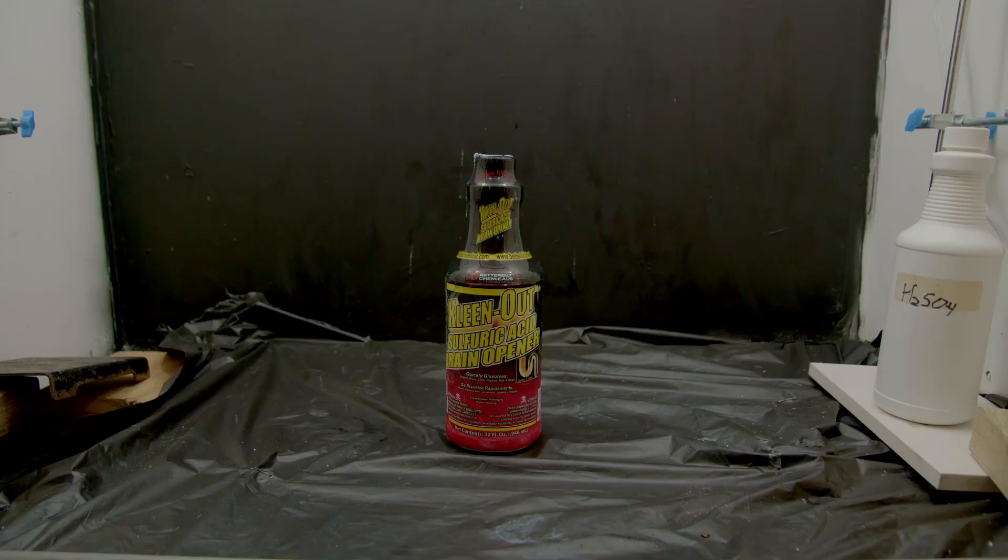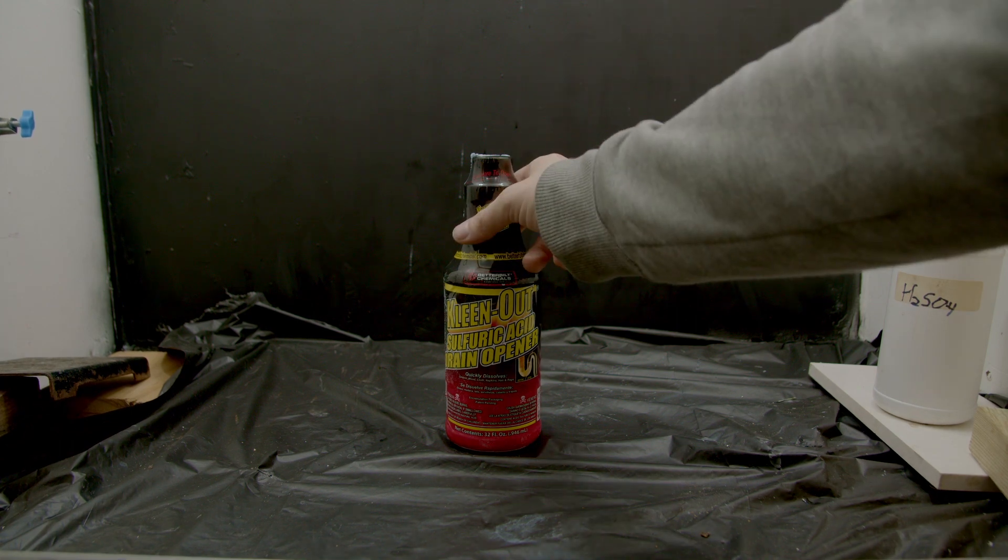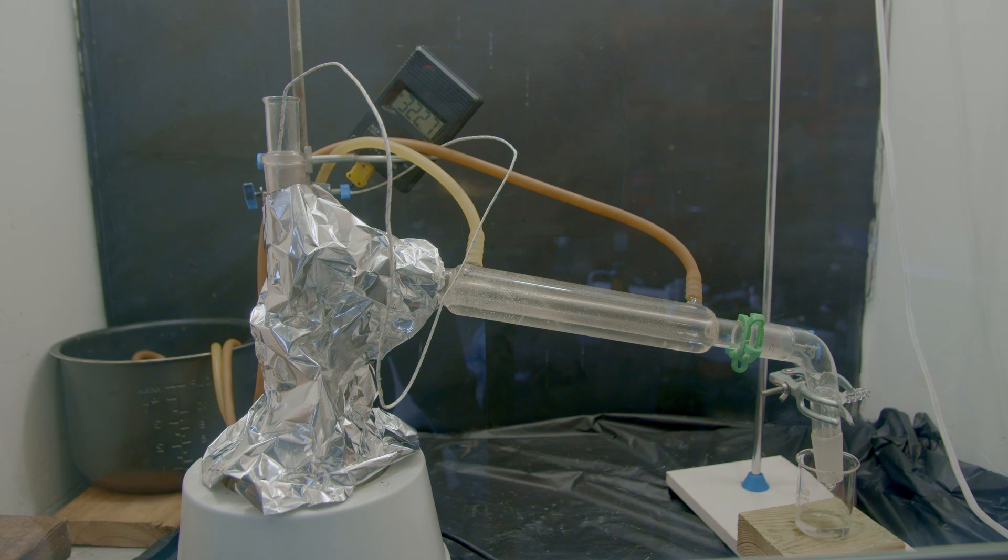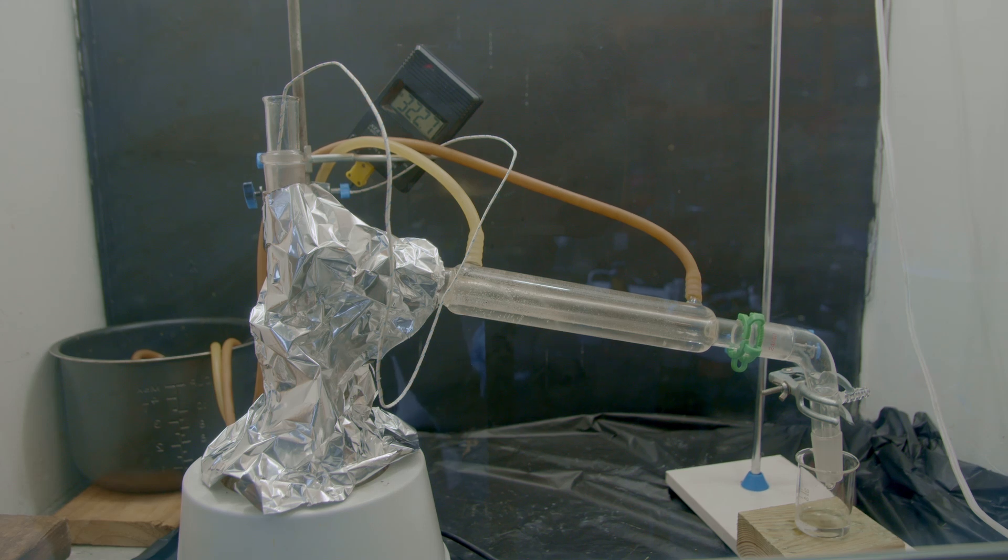So we're going to need sulfuric acid next. I found mine at Walmart as a drain cleaner and I went ahead and distilled it so that we could get all the water out of it. We don't want water in the sulfuric acid because it's going to mess up the final product.